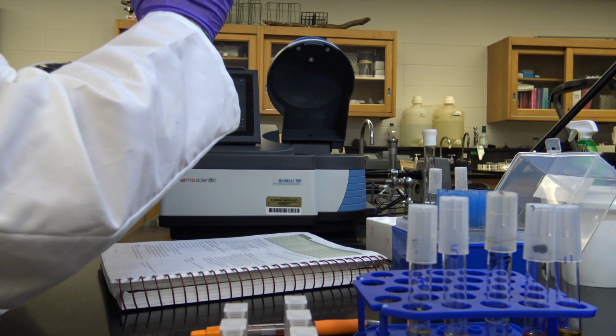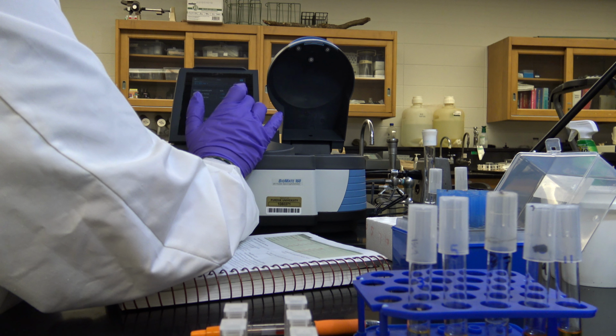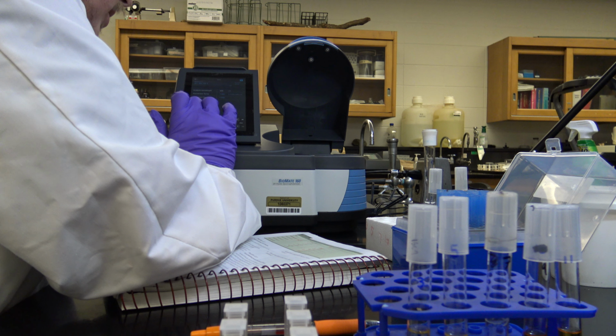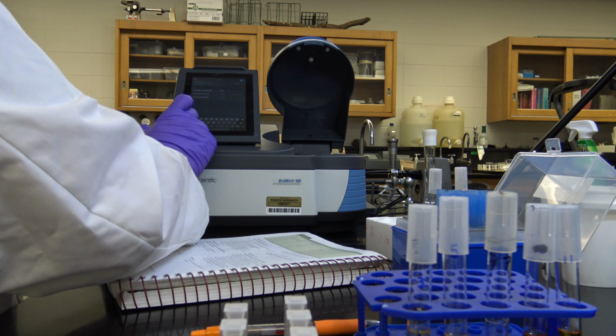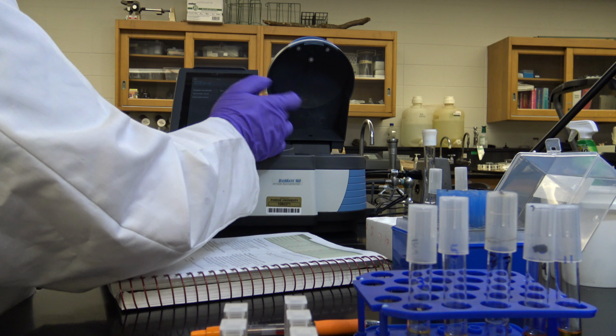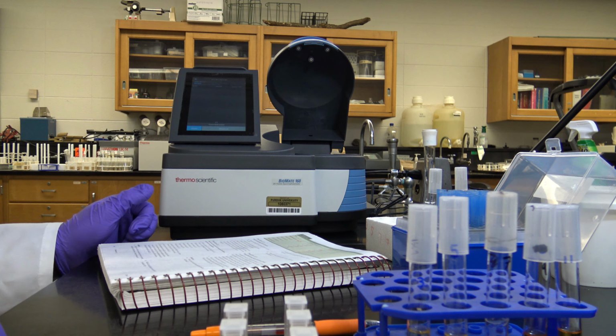And let's put the date on here, right? It is March 30th when I'm recording this. So we'll go 3-30. I don't know where the hyphen is. There it is. Okay, so we'll go ahead and go with that. Done, hit continue, right?